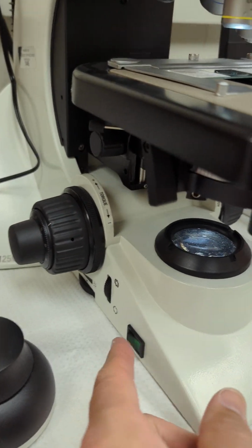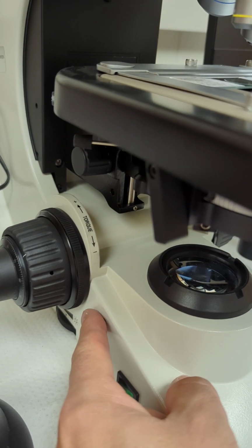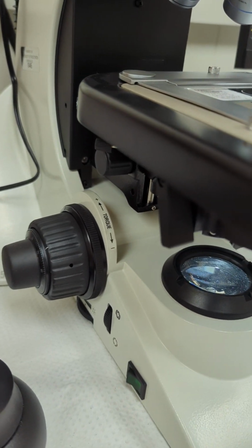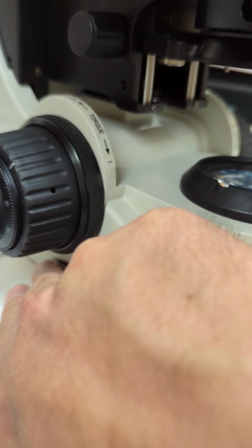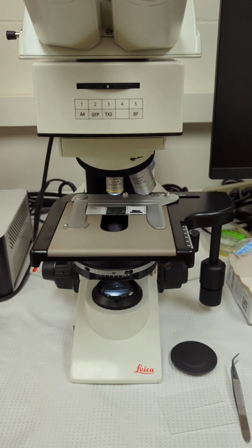The microscope is on, you can see the light coming out already. This aperture here is your field diaphragm. Just make sure that it's all the way open. And then down underneath the handle here is your intensity. So you can dial that down if it's too bright for you. And then just look in the microscope and start going.